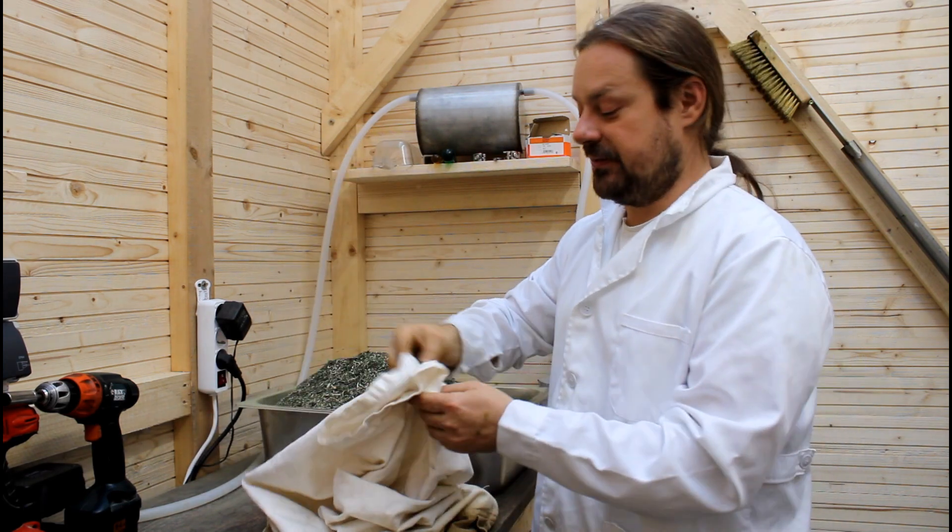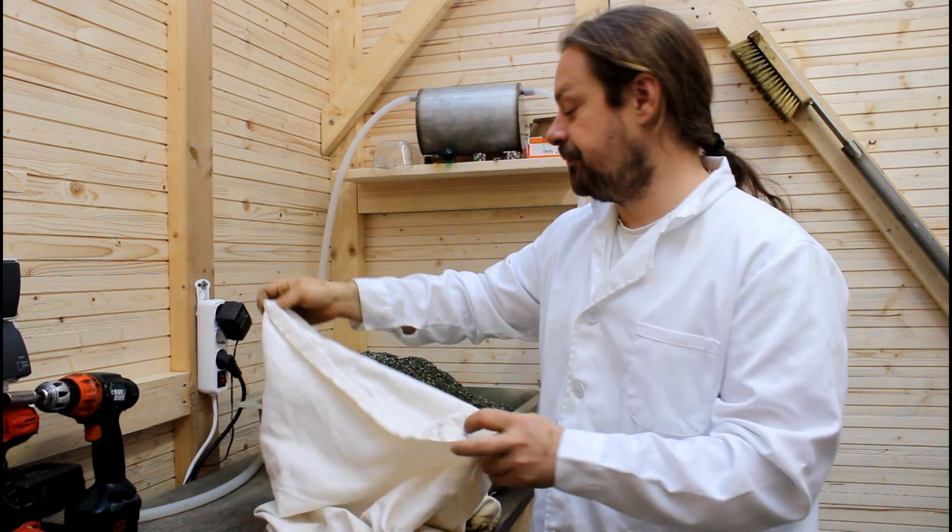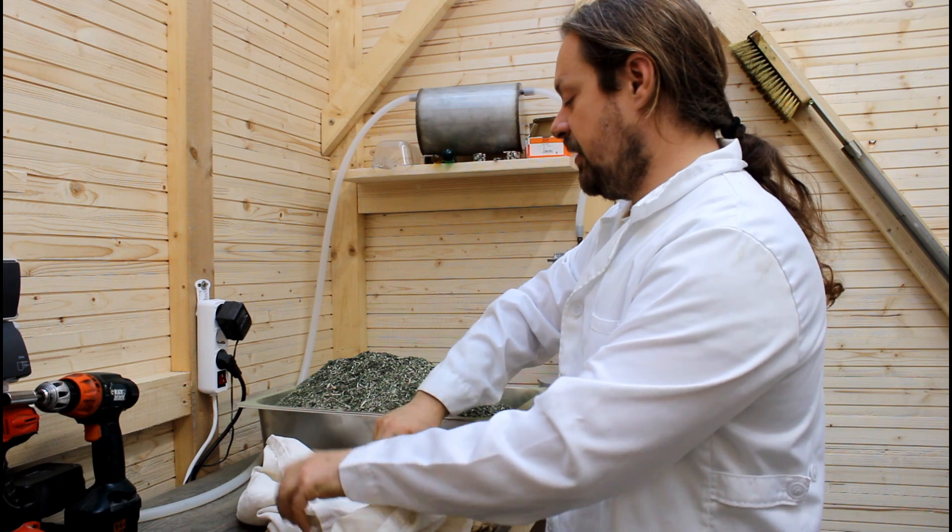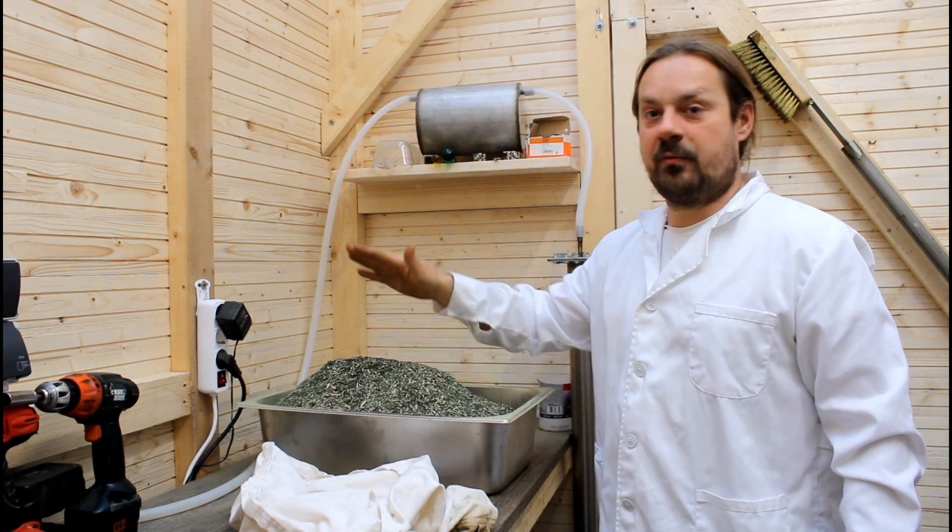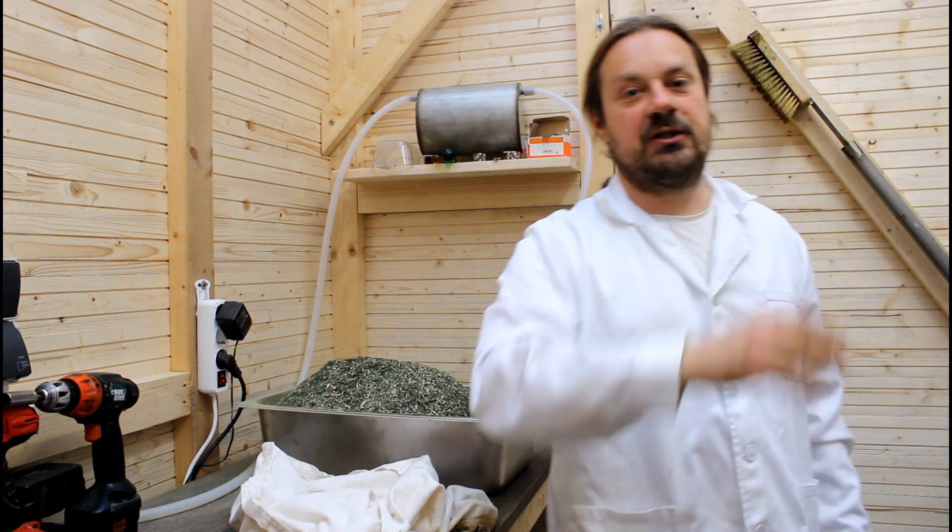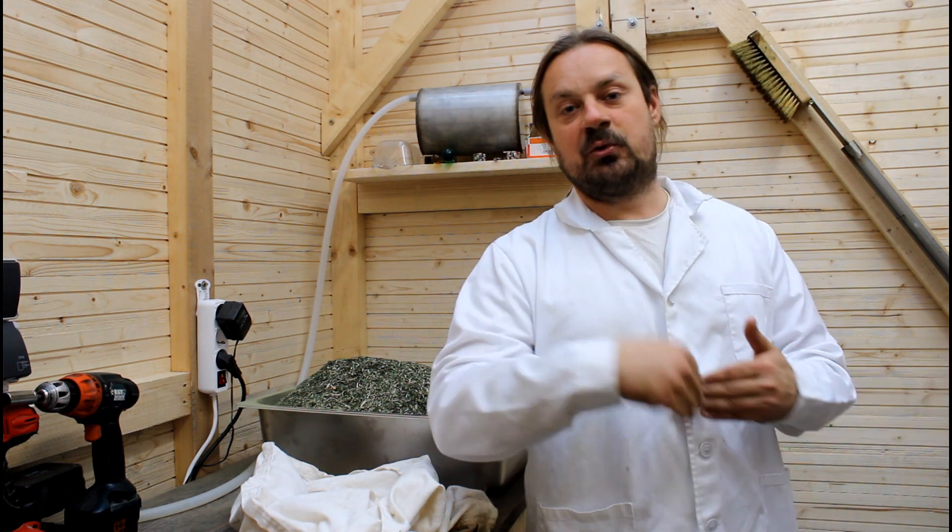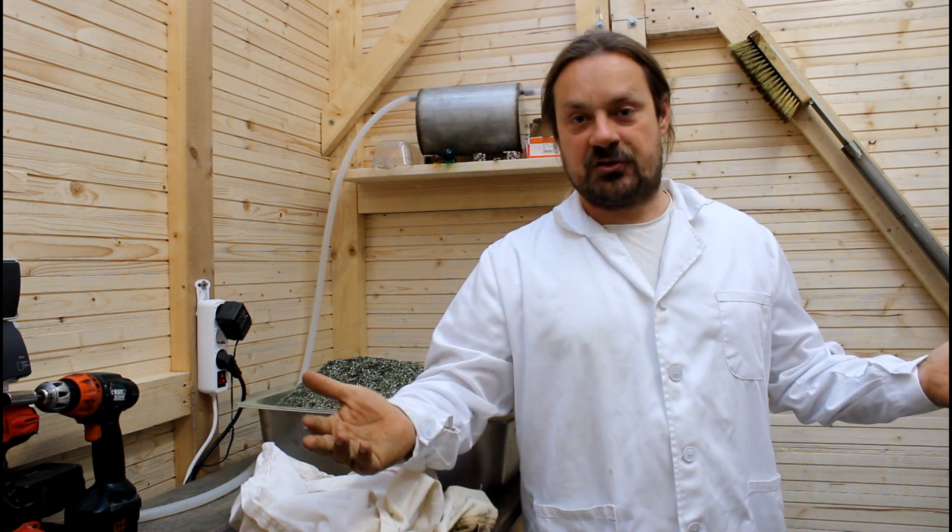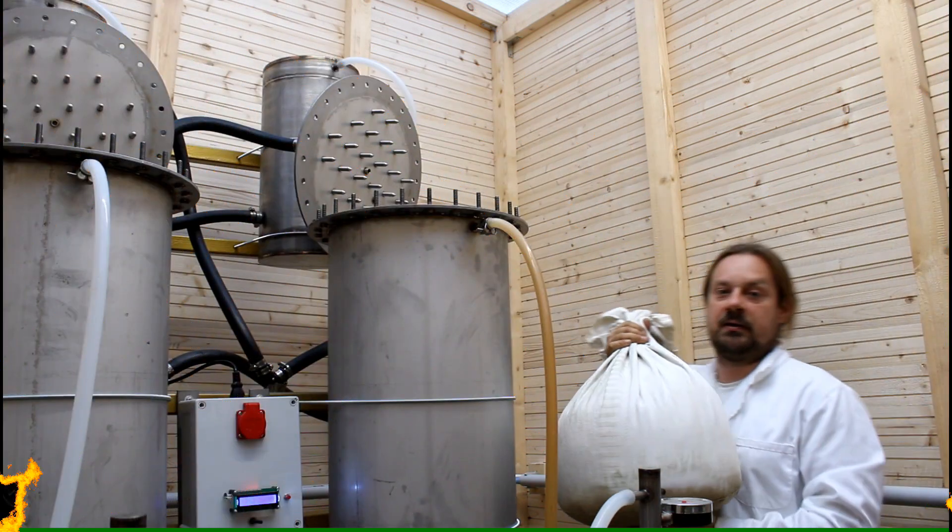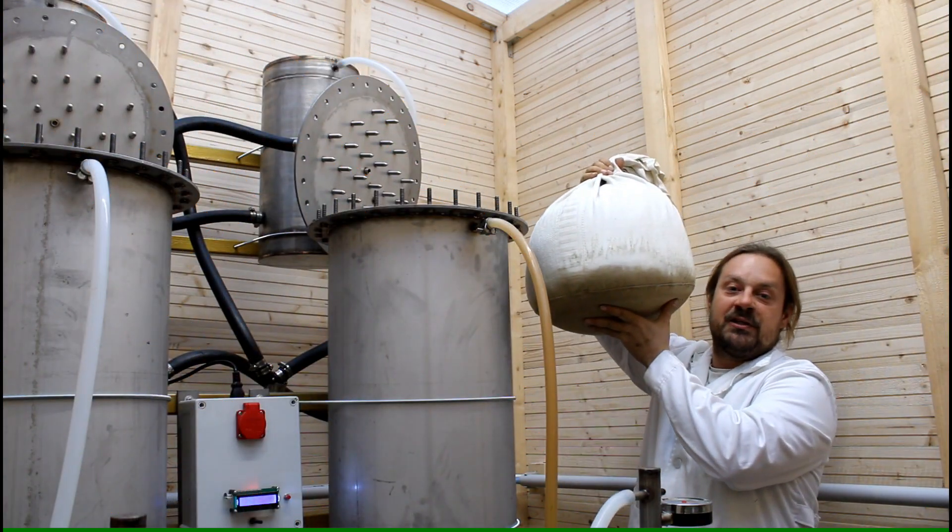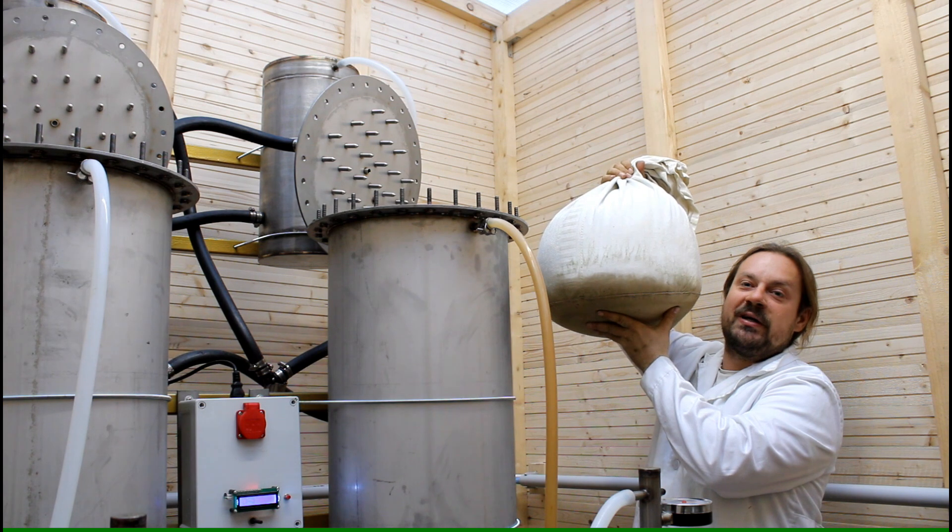Because they will dye the cotton in all kind of colors and after a couple of usages they will just look brown but in actual fact that's freshly washed. The idea is to fill the herb in the bag, put the herb in the machine, seal everything, put vacuum on it and run the system.